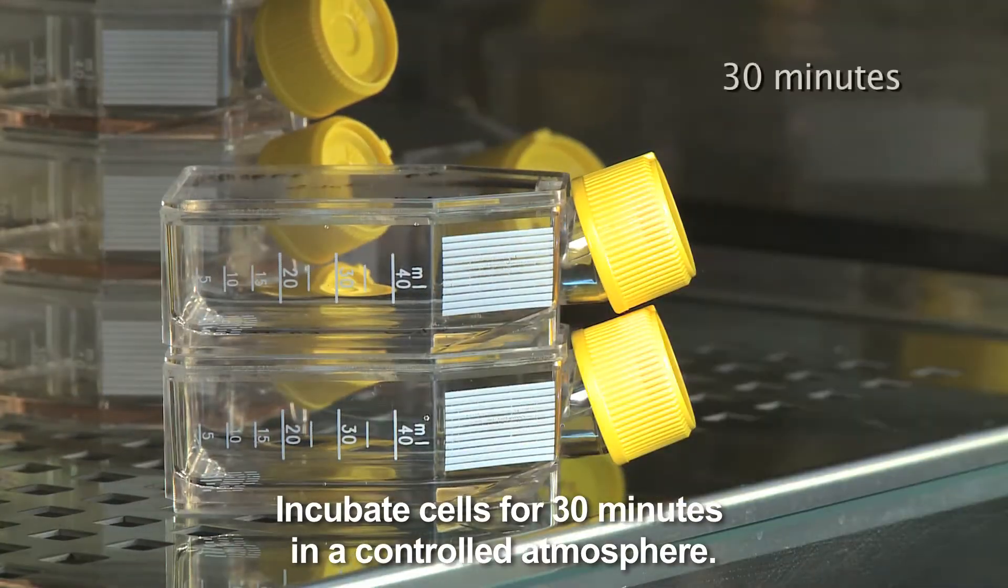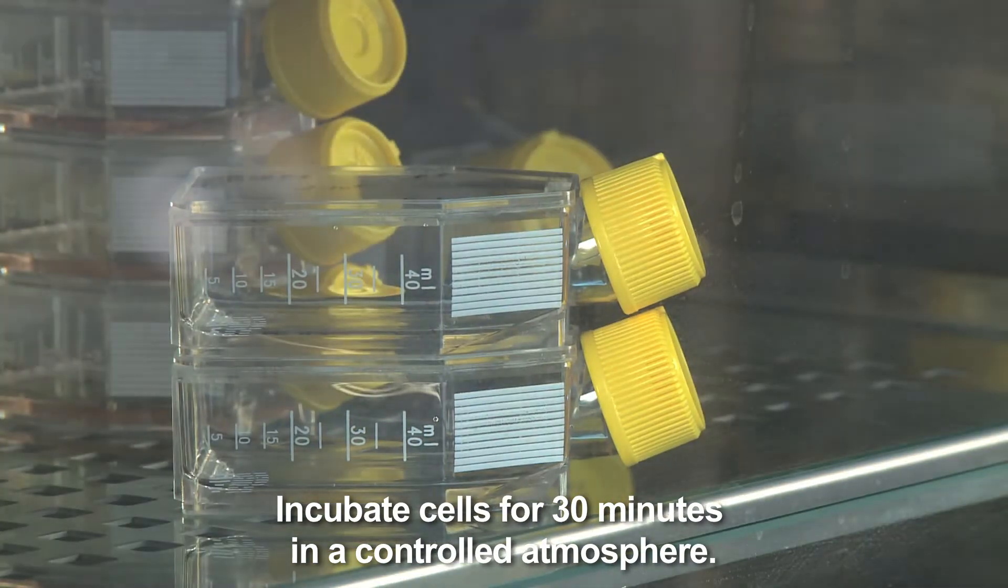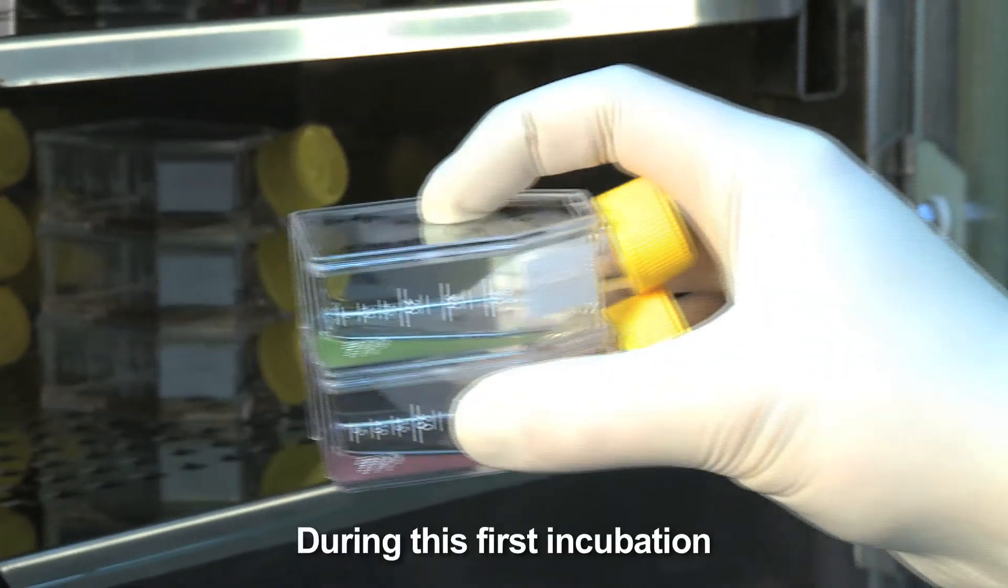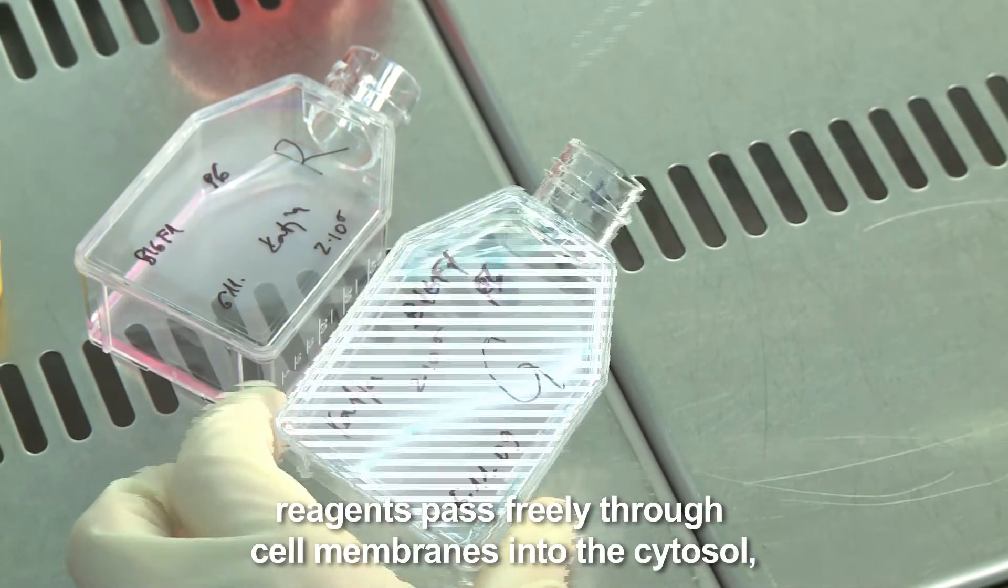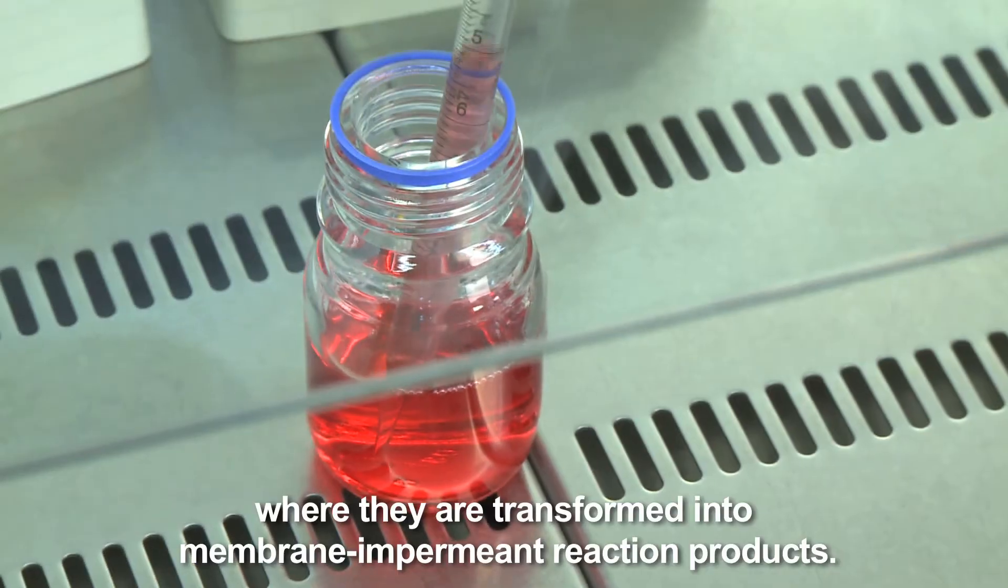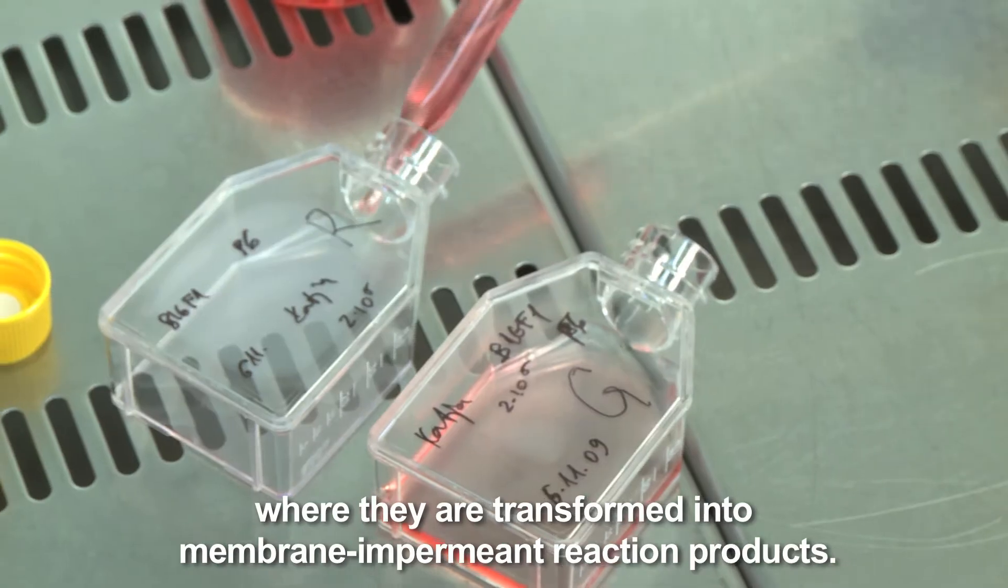Incubate cells for 30 minutes in a controlled atmosphere. During this first incubation, reagents pass freely through cell membranes into the cytosol, where they are transformed into membrane impermeant reaction products.